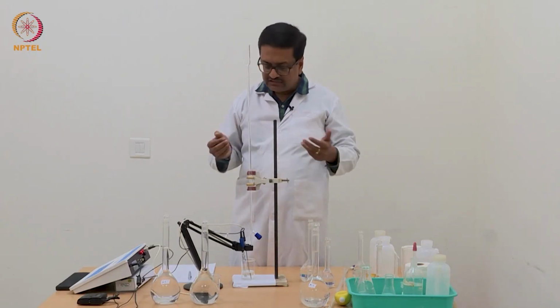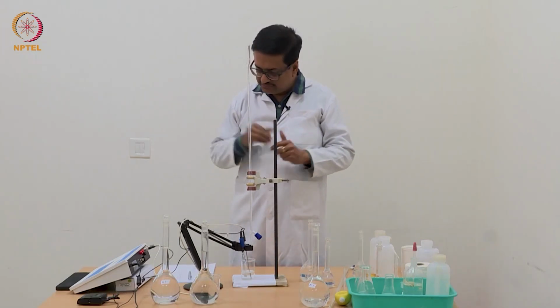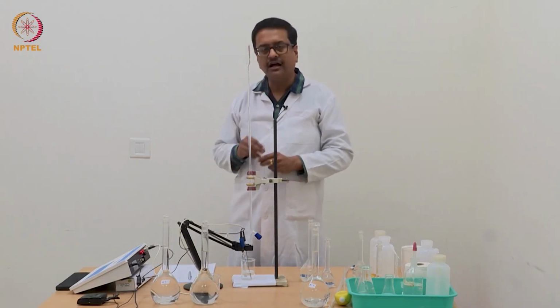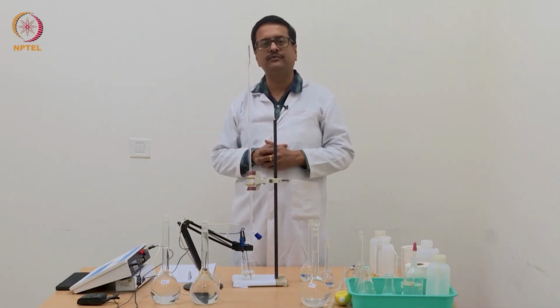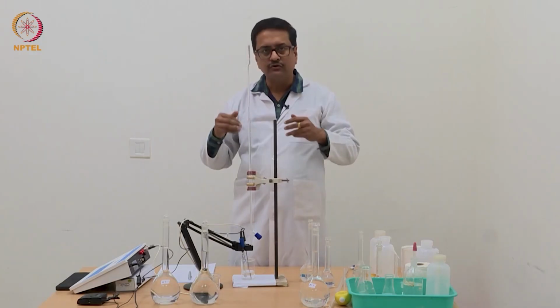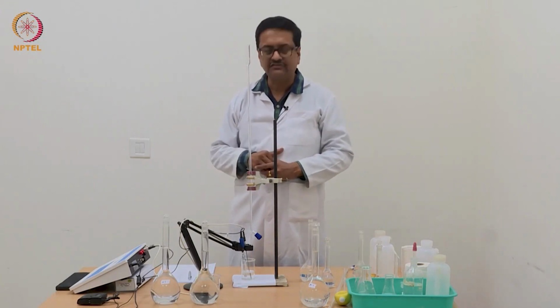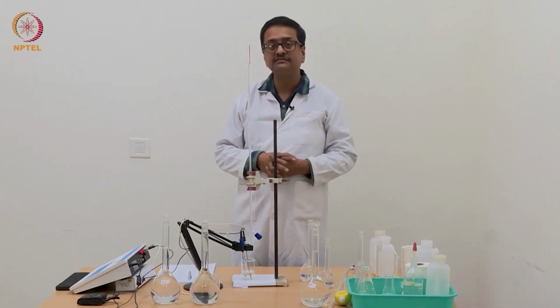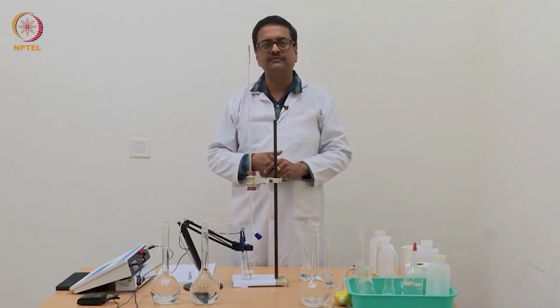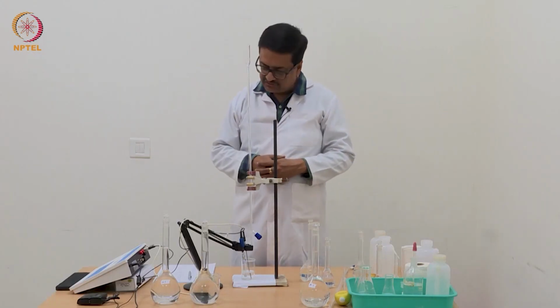One should actually try to plot these data in the same graph paper and compare them quantitatively together and see how the shape of that S curve is different from strong acid strong base to weak acid strong base to a weak dibasic acid to a strong base. So I will discuss this during the theory class with the plots that we would generate from this data, and we will have a complete discussion after the experiment is over today.